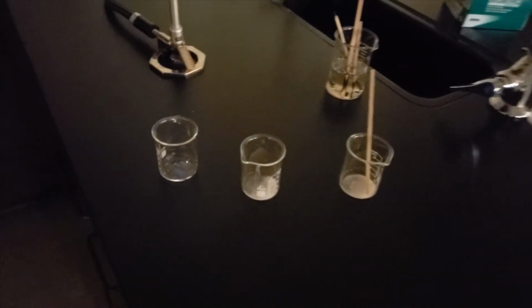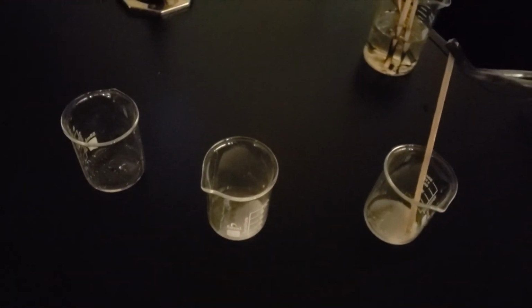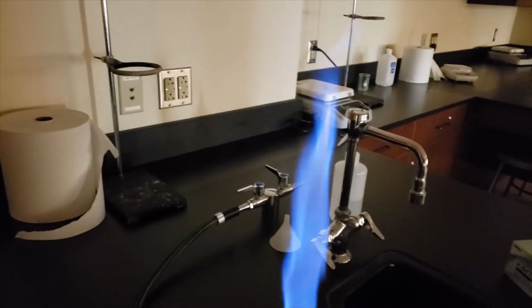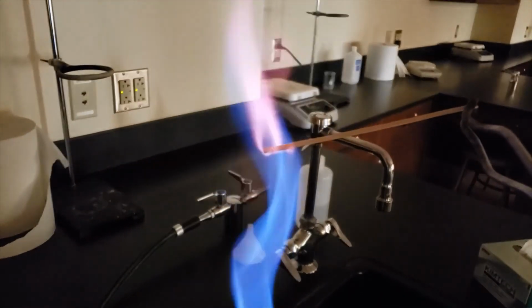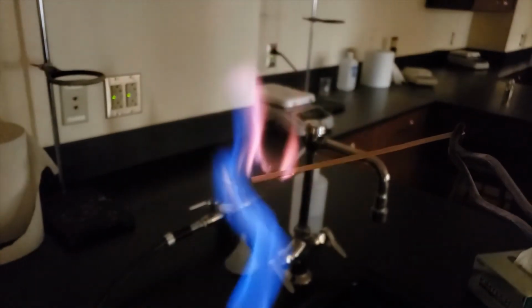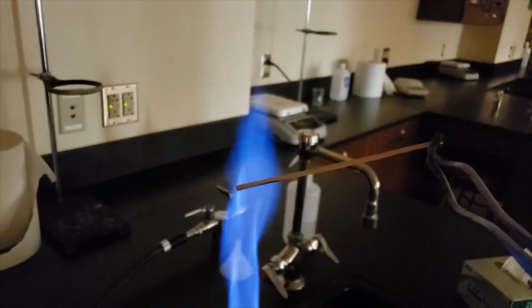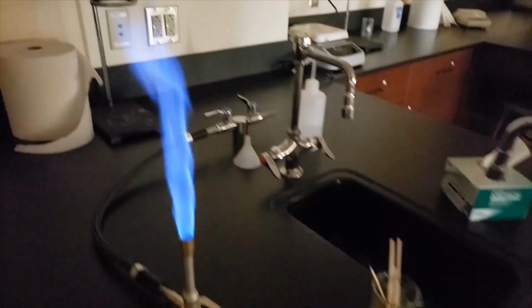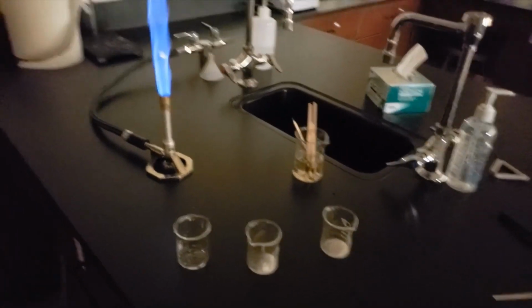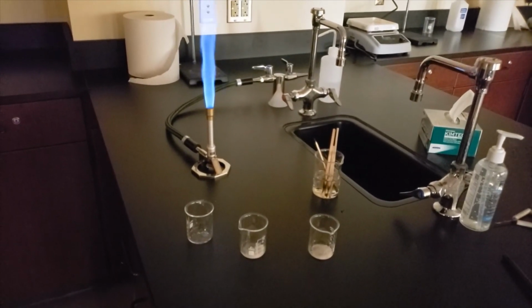Okay, here's our last sample. Our last sample is here on the right. And when I ignite this sample, we're going to look very closely into the color that we see here. That looks like a lavender, very pale pink color at the edge of this wooden splint, and it's kind of flickering in and out. Based on what you just saw, you should be able to identify the unknowns that were contained within each one of these samples.